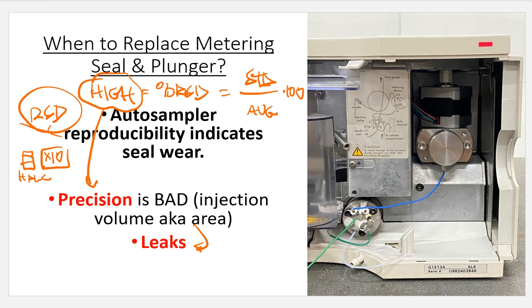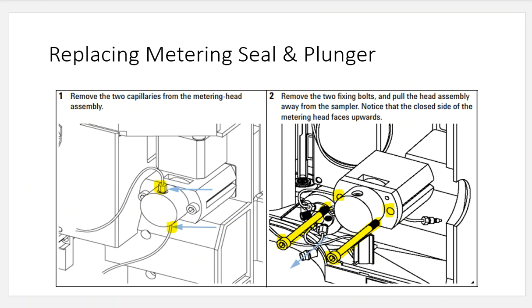It should be the same sample amount over and over and over and over and over. So that analytical seal, very important. In order to get to these and in order to change them out, very simple to do. I'm going to disconnect the tubing lines that are from the top and from the bottom. Remember, the one on top is from the needle. The one on bottom is from the injection valve. I'm going to disconnect those two tubing lines.